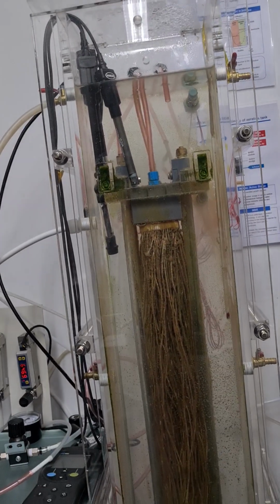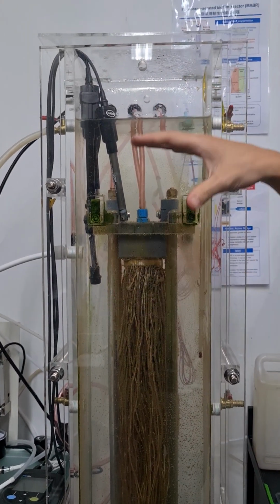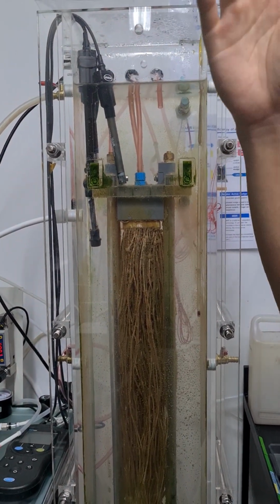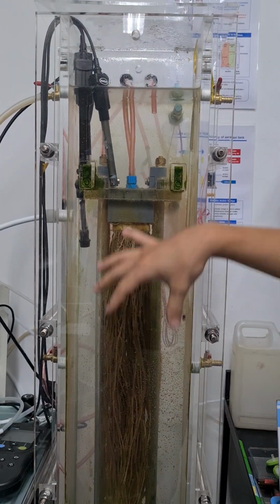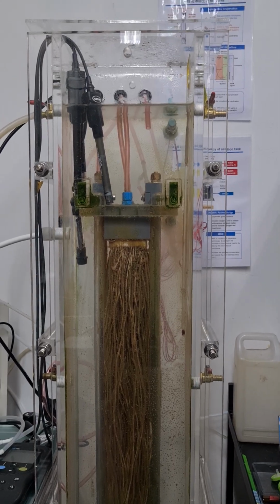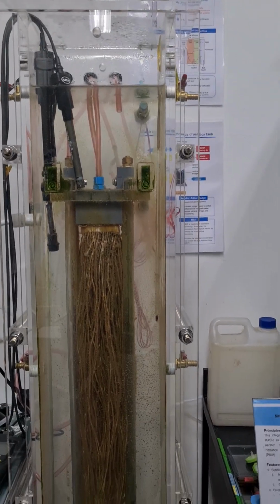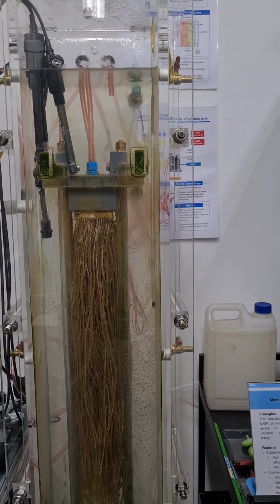The specific surface area means the ratio of your membrane surface to your reactor volume. In our study, this value is quite low, but in some studies it may be up to 400 or higher, so the reactor will be very occupied by the membrane. We didn't design for a high value. It will be a problem if it's full of membrane inside, because you have to make the liquid inside well mixed.